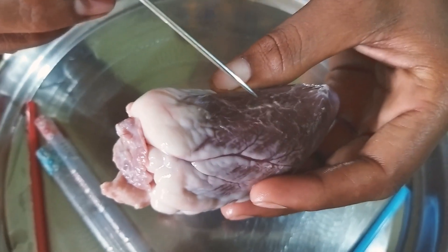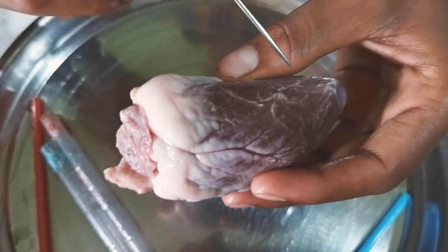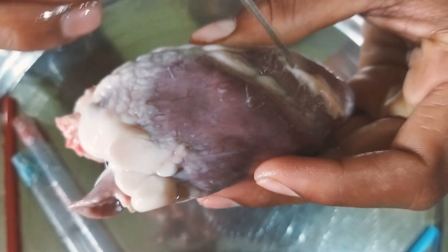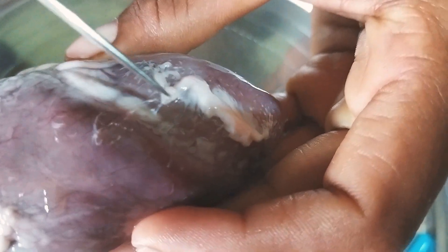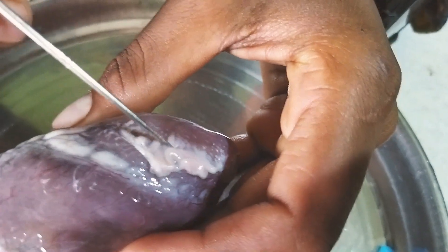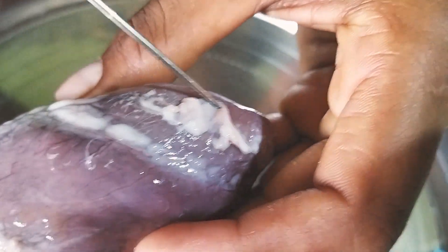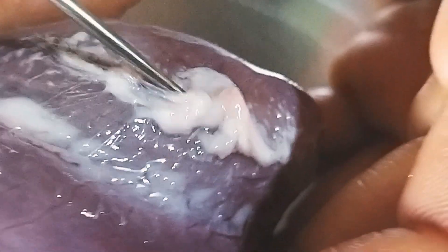Here you may observe a small fluid. I removed this membrane — that membrane is known as the pericardial membrane. In this pericardial membrane, there is a pericardial fluid. This will protect the heart from shocks and impacts.